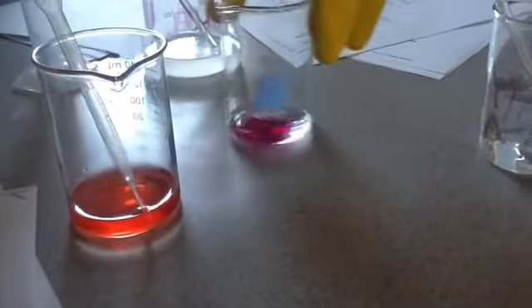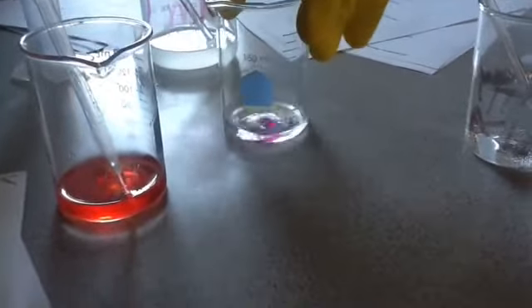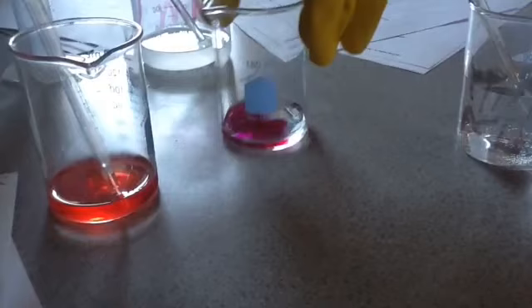Again, I'm doing it very quickly just for demonstration here, but it looks like we're really close to hitting neutralization. Typically when you're doing a titration lab, you want to use a dropper, make it go a drop at a time, swirl it, so you can get as accurate as possible here. You want to get the exact amount of base as volume to neutralize your acid.